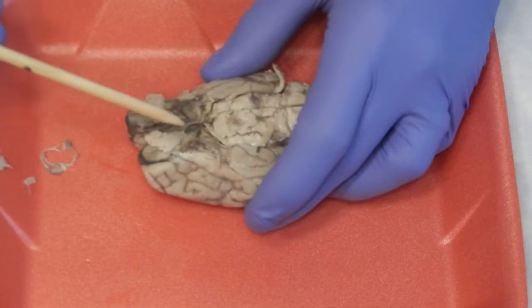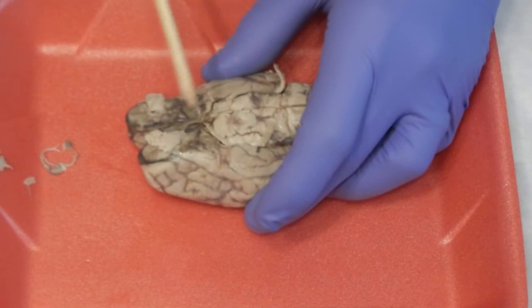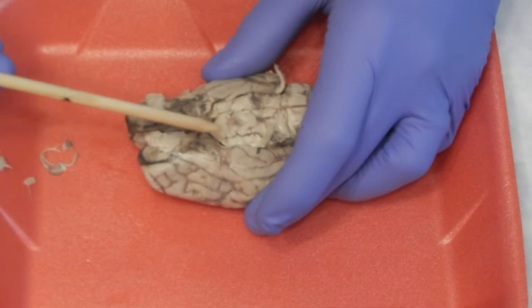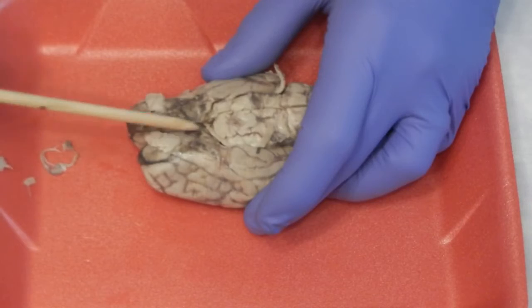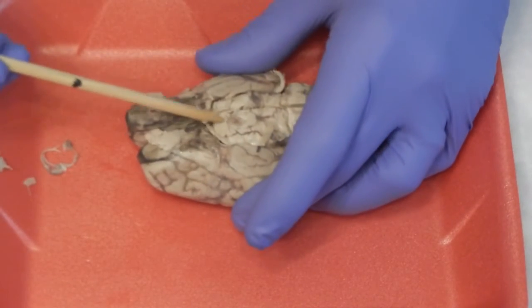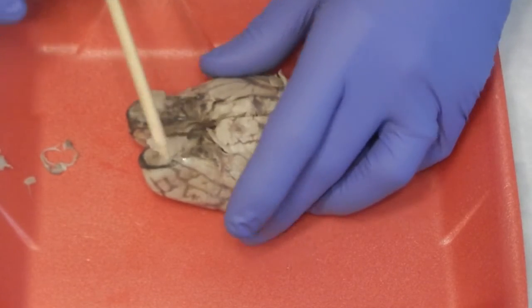If you go back to the video that I did before about the skull and going through the bones of the face, you saw that there were two fissures, or two openings, in the back of the skull, or in the back of the orbits, or the eye sockets. That's where the optic nerves come in, and they cross in an X, as I said before, at the optic chiasm, which goes to the optic tracts that go to the back.